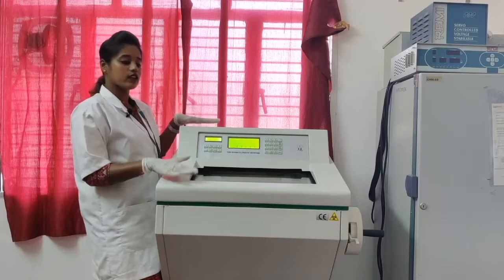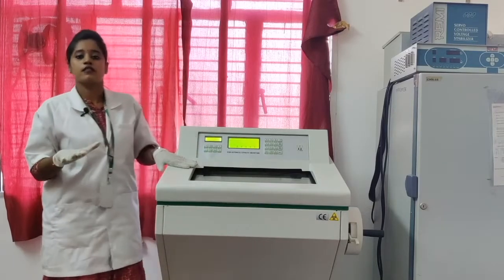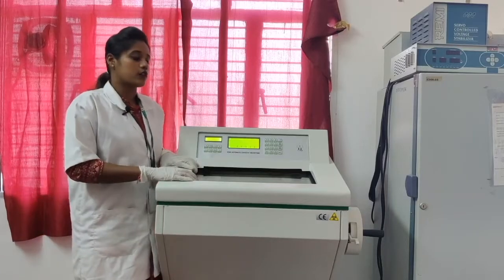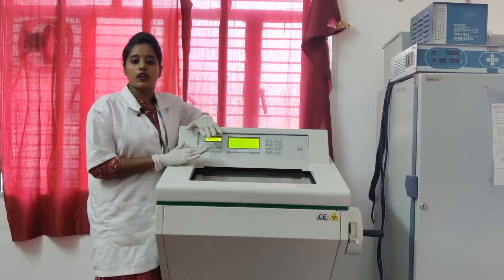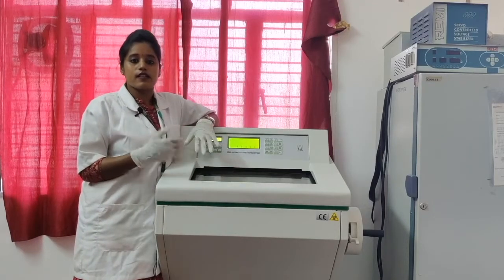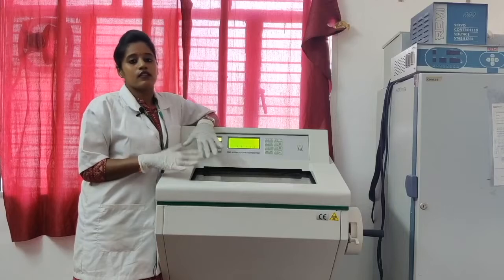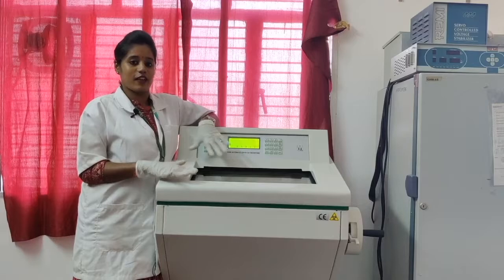Already I had turned on the equipment to stabilize it, but some instructions are given to keep the equipment stable. The equipment needs only 50 Hz to maintain it, but if the voltage increases above 250, then the parameters fluctuate in the equipment.